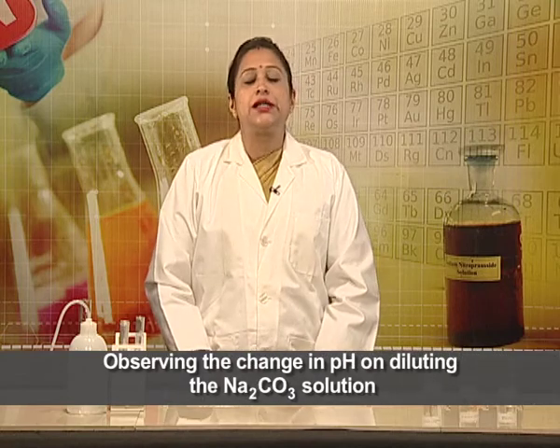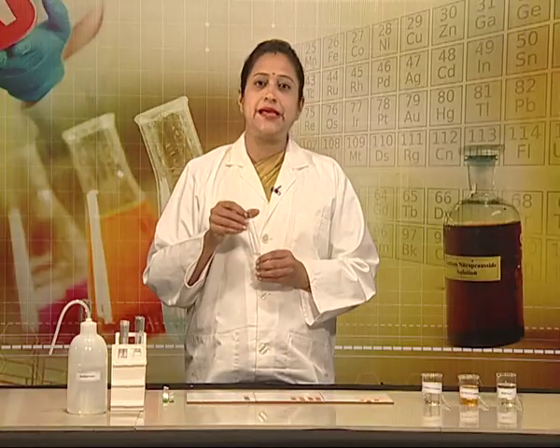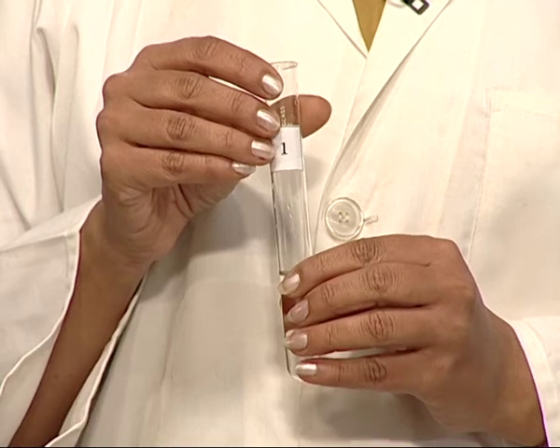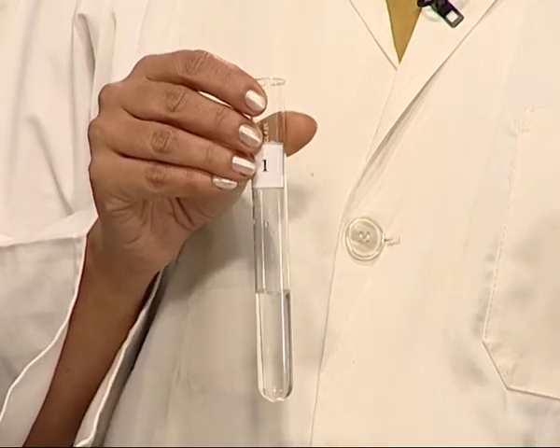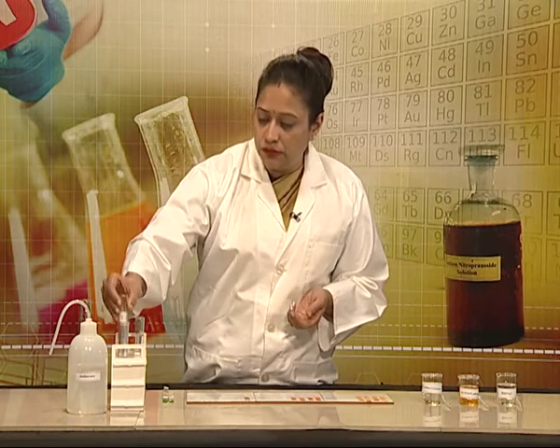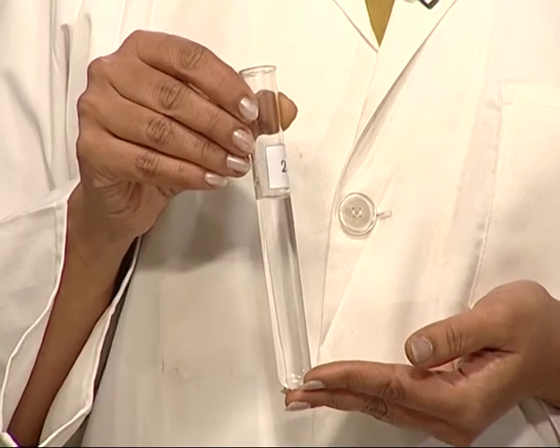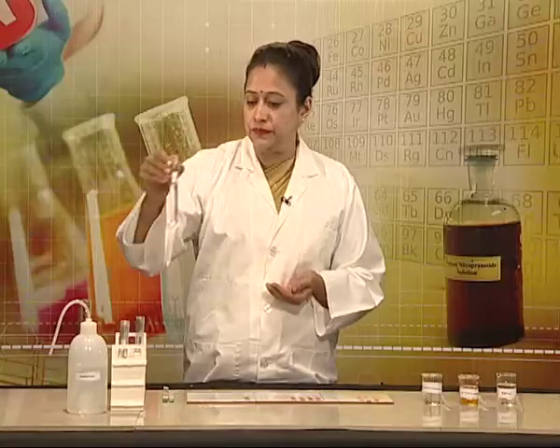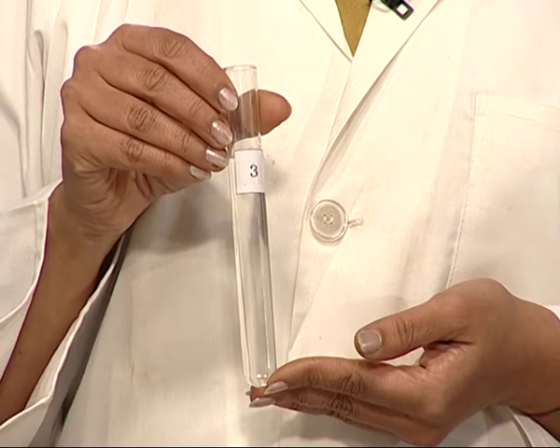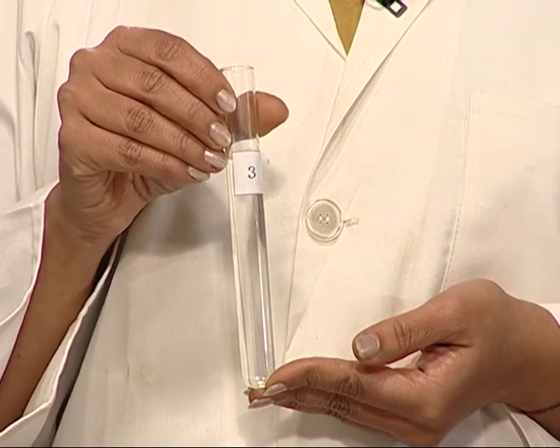Let us now move on to our third solution — sodium carbonate. The steps are the same: 10 ml of distilled water and 1 ml of 0.1 molar sodium carbonate solution in test tube 1, shaken well. Test tube 2 contains 15 ml of distilled water and 1 ml of sodium carbonate solution. Test tube 3 contains 20 ml of distilled water and 1 ml of 0.1 molar sodium carbonate solution.